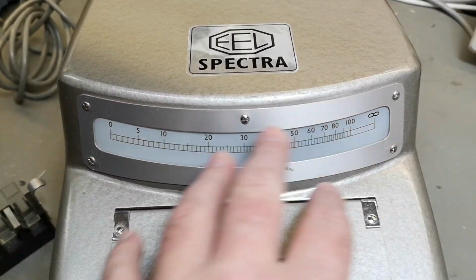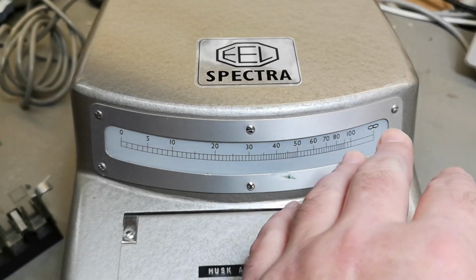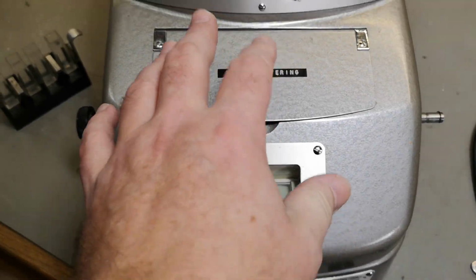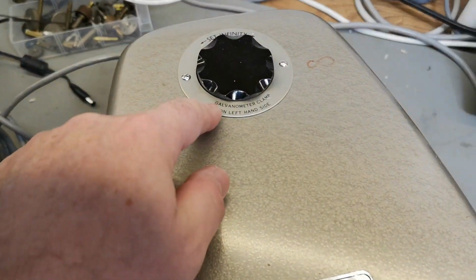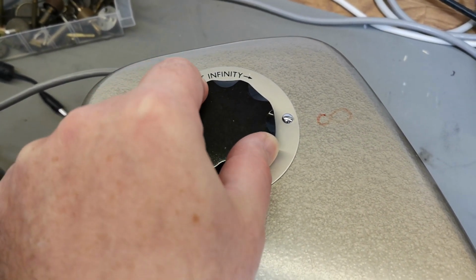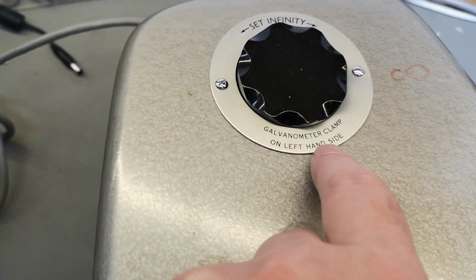Haven't yet figured out what is going to happen on this. Is probably also maybe an intensity readout of the different wavelength you manually tune here. I believe there is something like a meter in here that moves depending on the intensity, because there is a galvanometer in here. So this is set for infinity, and there is a clamp, probably a transport clamp on the left side here.